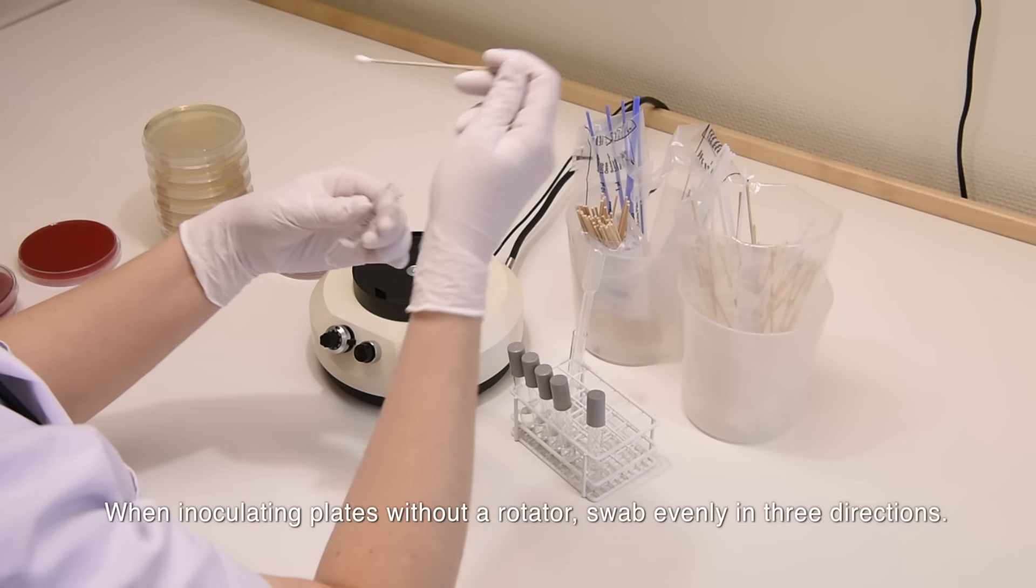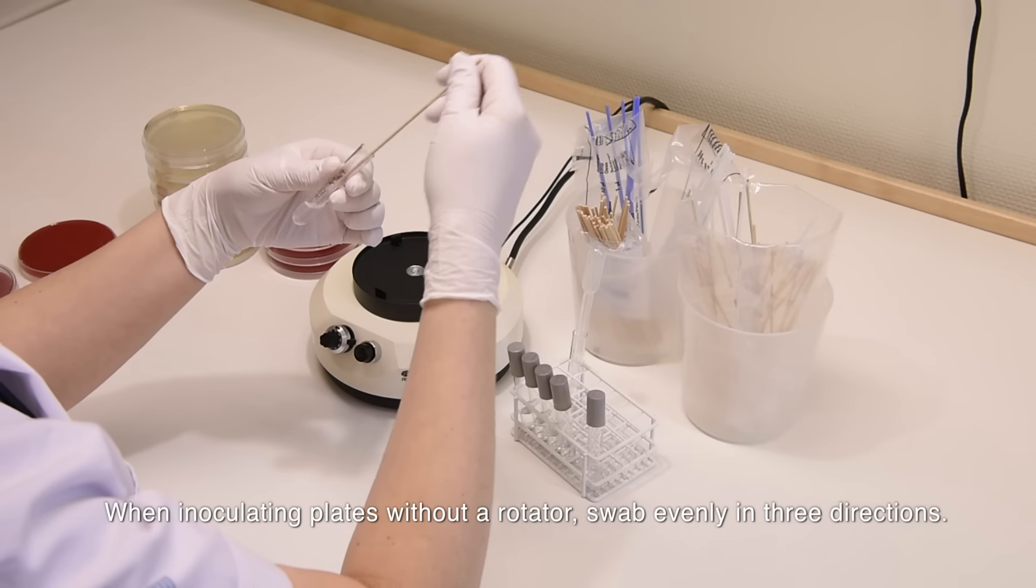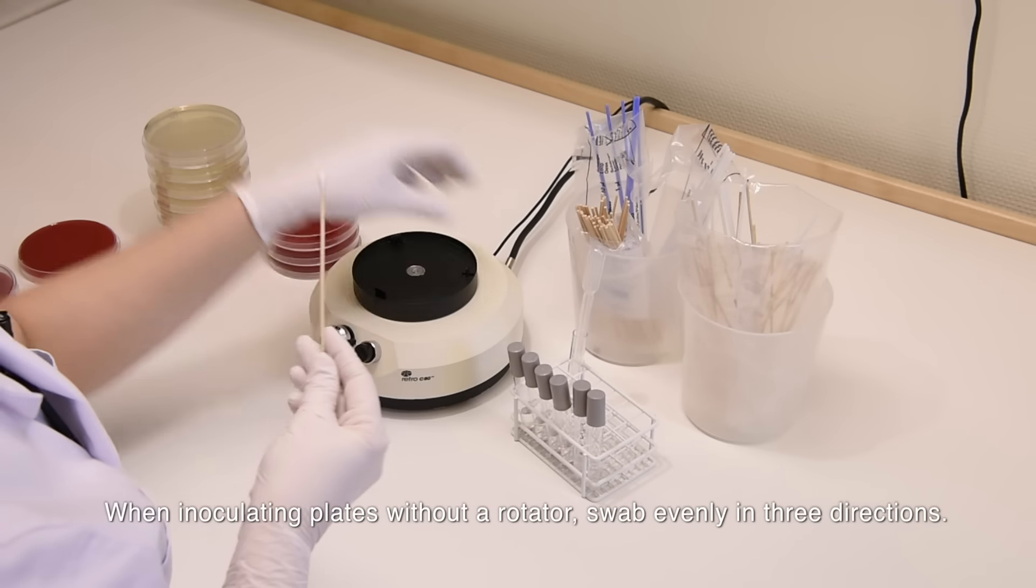When inoculating plates without a rotator, swab evenly in three directions.